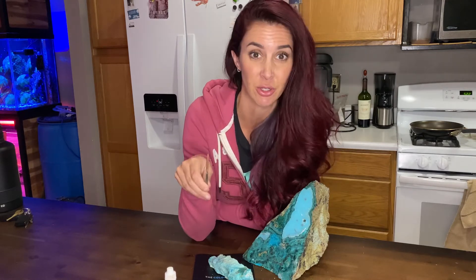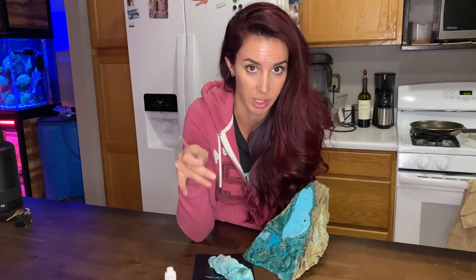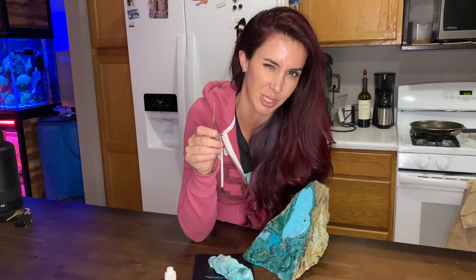I really hope you enjoyed this science experiment — it is truly one of my favorites. It's quite fascinating, great for kids and adults alike, and makes a really cool party trick because people don't think it's actually going to work. Plating metal without electricity has been around for a very long time, so this is a pretty sweet experiment.